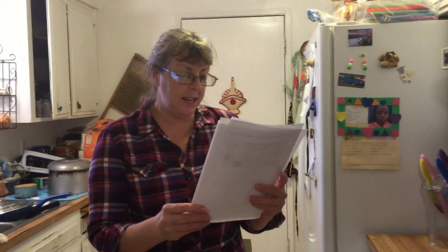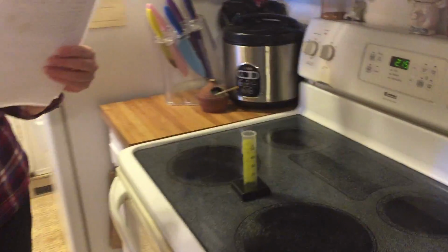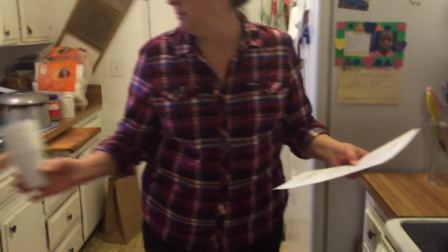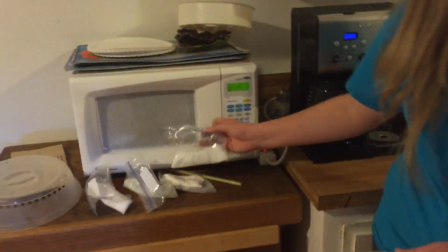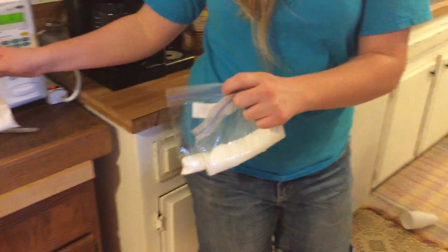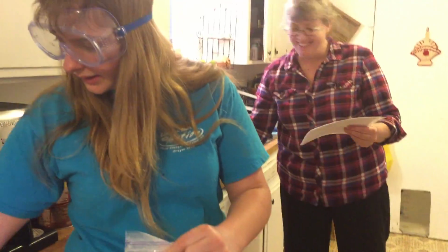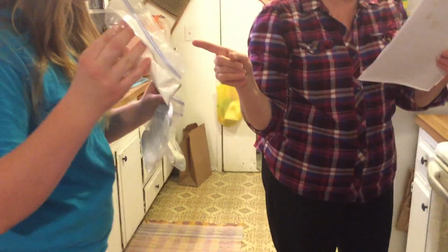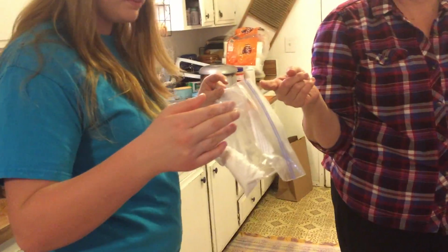Let's bring everything over here. We need a graduated cylinder. Yep, check, okay. Styrofoam cups. Good. Those are dirty. Well, we're going to rinse them, so we'll leave them by the sink. Okay. And all these things of powderiness. Okay, so here's like what these ones we need. These, plaster of Paris.